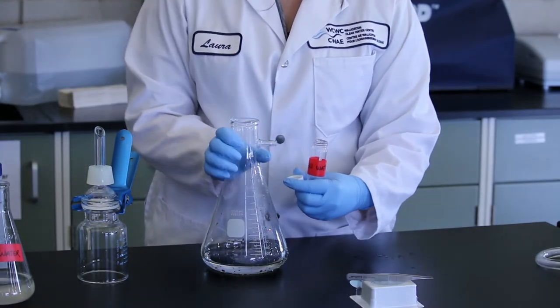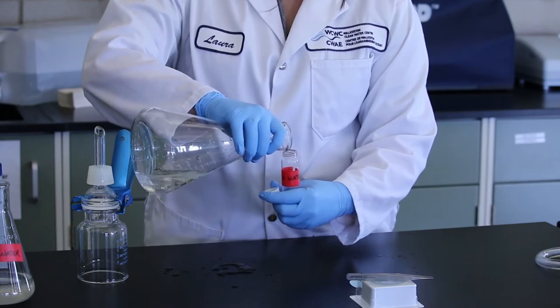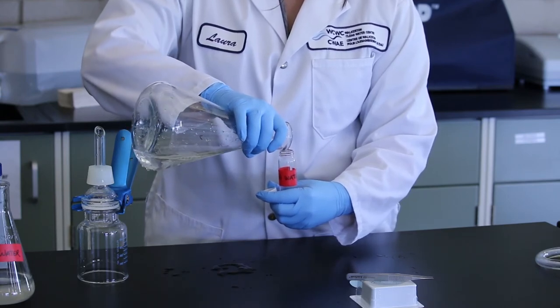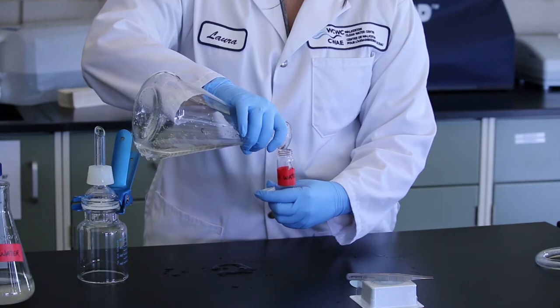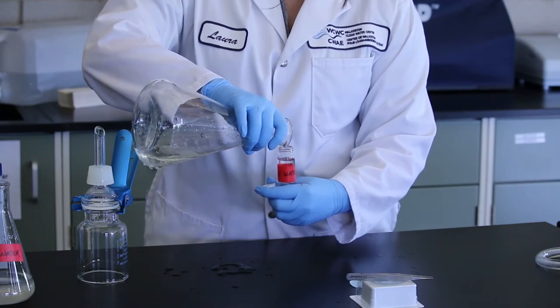To measure total organic carbon, do not filter the samples. The filtered water is then transferred to a total organic carbon vial and is ready for analysis.